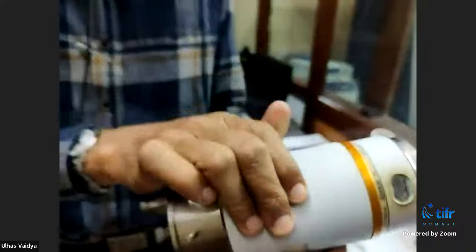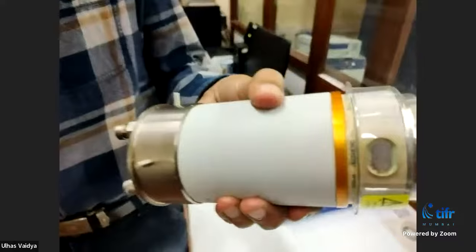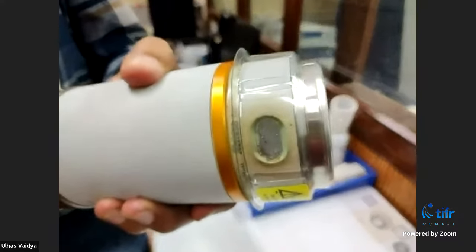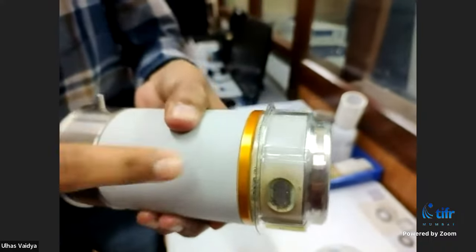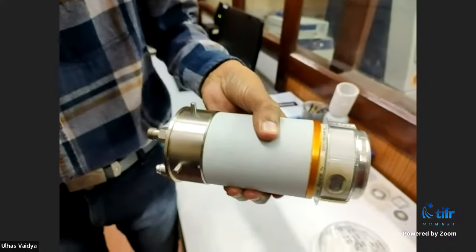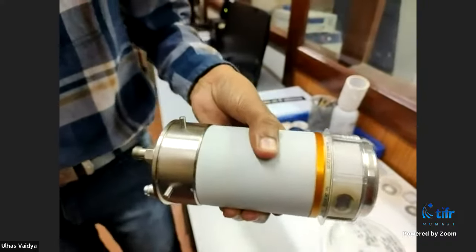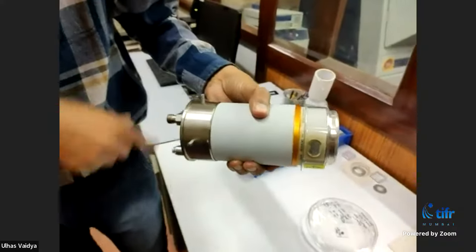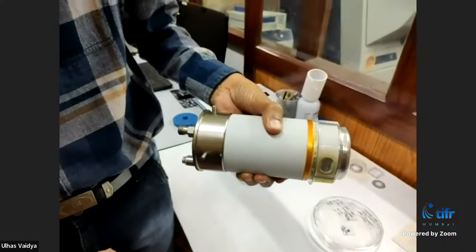The X-rays generated come out from a special window. The copper target is inside at one end, the filament and other components are here. Electrons go and strike on the copper target, and then X-rays come out from this window. X-rays actually come out from all sides, but this window is specially made for focusing on the sample mounted in the diffractometer.